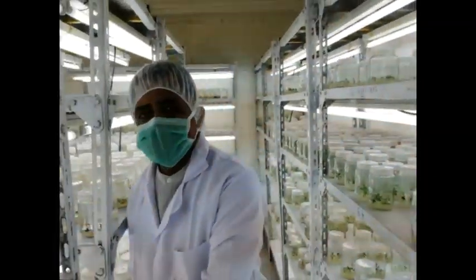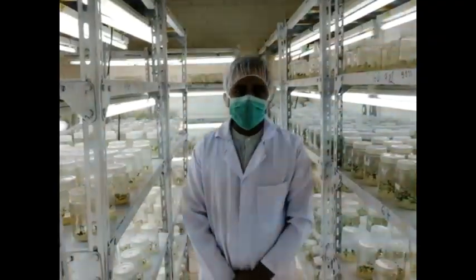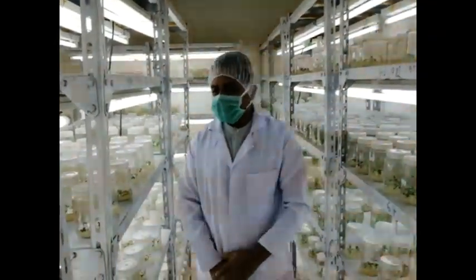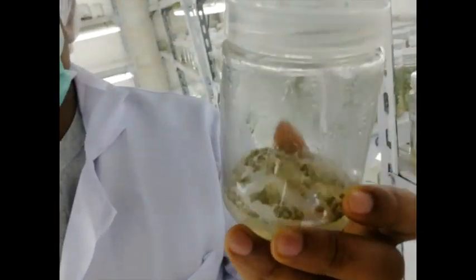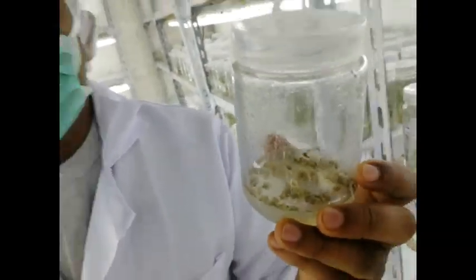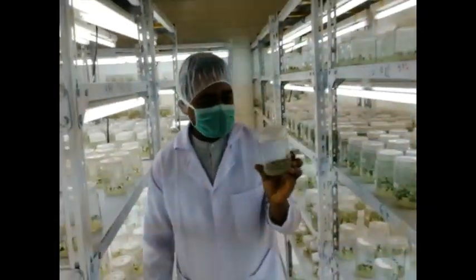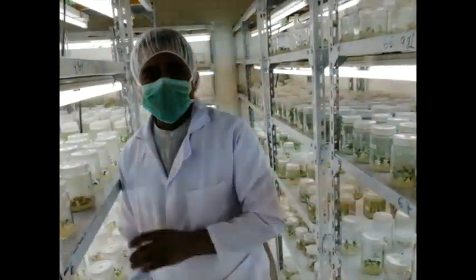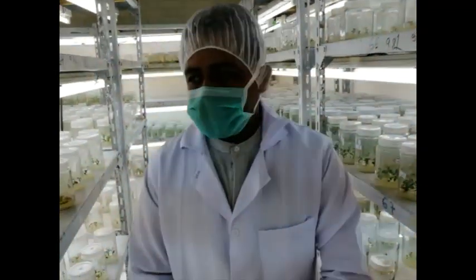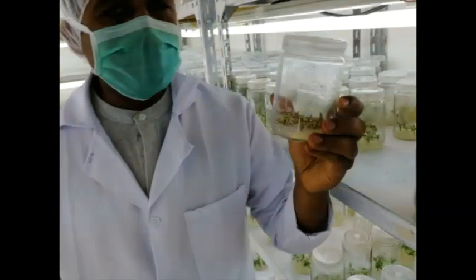However, sometimes we misidentify the right embryogenic callus. Due to that, these calli are unable to regenerate into embryos. So this is the major problem that we are facing in our lab, and we are looking forward to some technical backup on this. After the embryos have regenerated, we proceed to embryo development for the maturation stage.